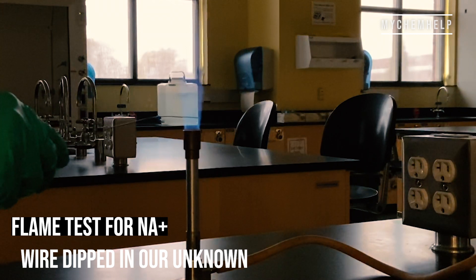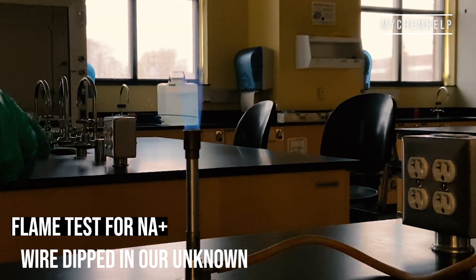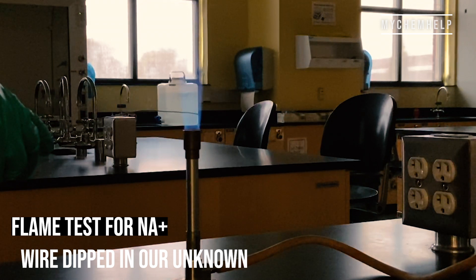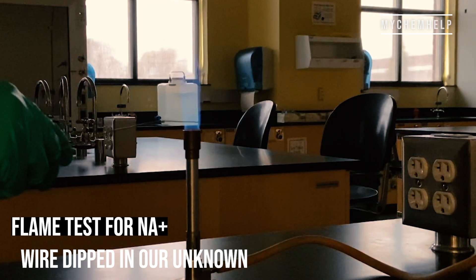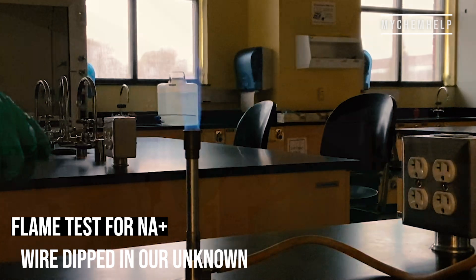So now it's time to test the unknown for sodium. I can't really see much happening, but I'll leave that up to you guys — what do you think?